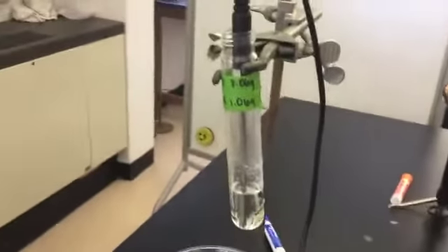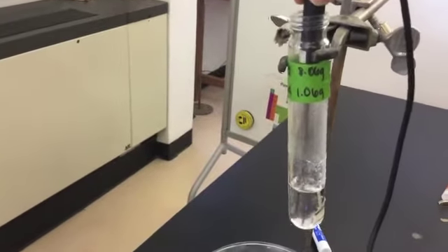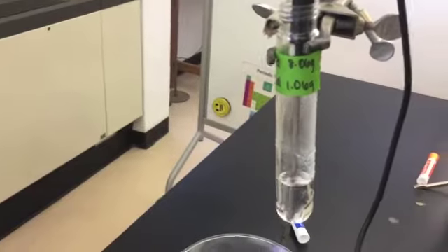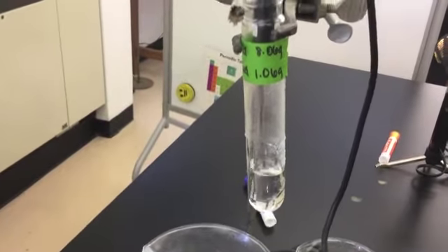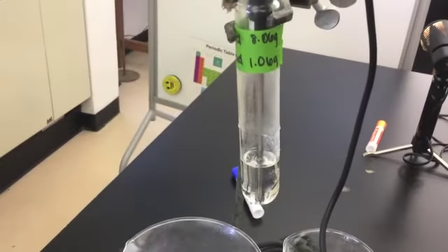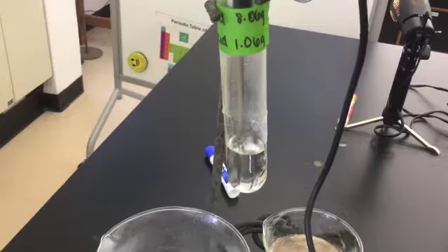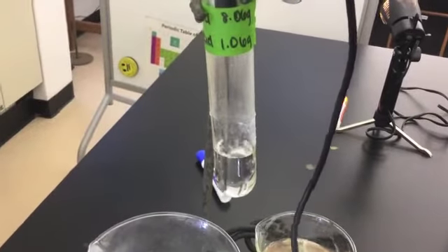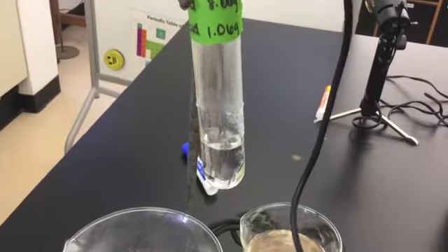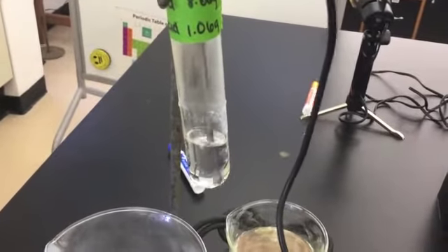Once your mixture is completely melted, it is important to stir it thoroughly. We want to make sure that the concentration of the benzoic acid in the lauric acid is the same throughout. If this is the first time that this particular test tube has been used, there's a decent chance that the materials were not spread evenly to begin with. You will know that it is the first time if the materials appear powdery rather than one solid lump.